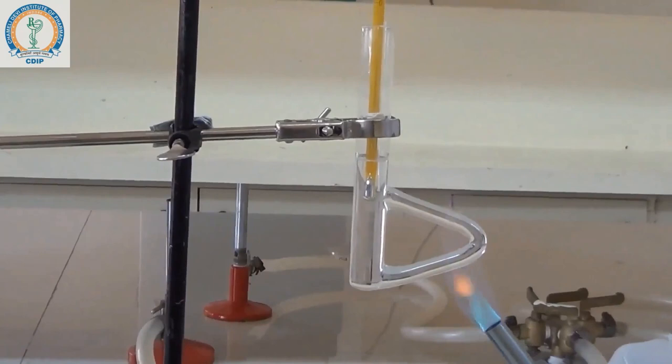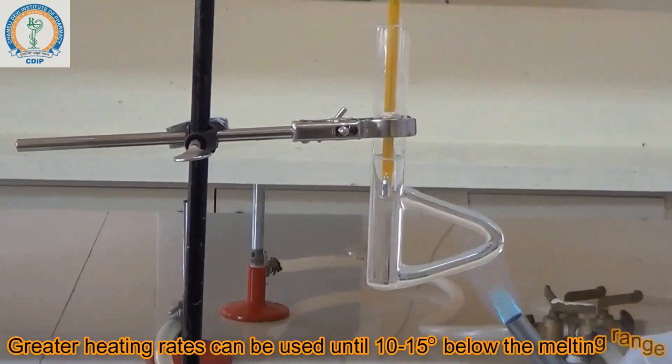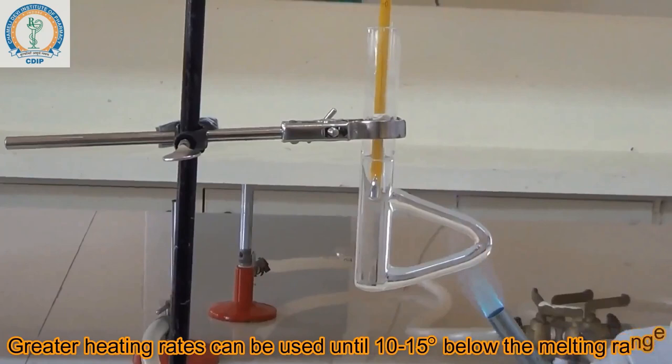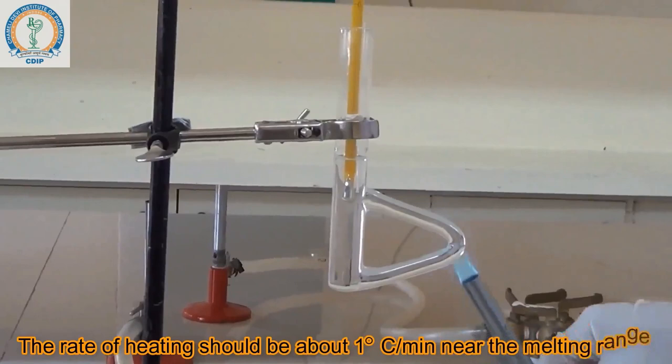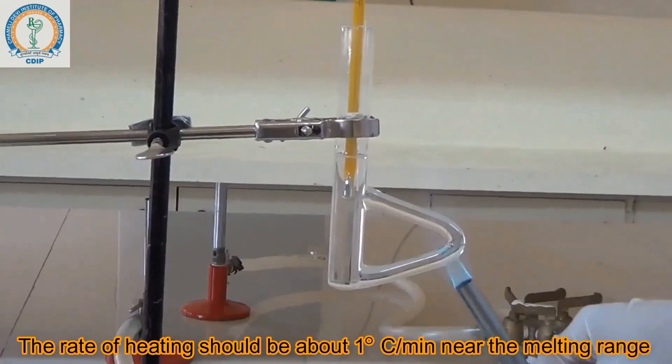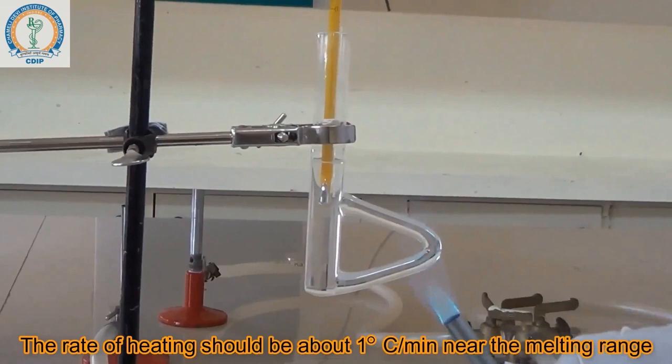The substance under examination is benzoic acid, and the melting point for this is 121 to 122 degrees centigrade.